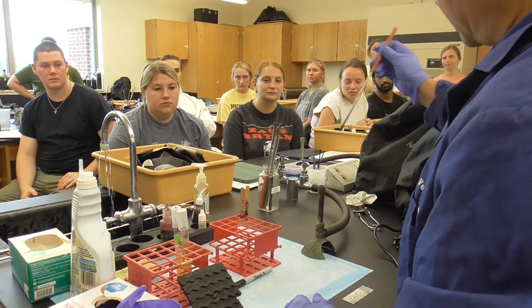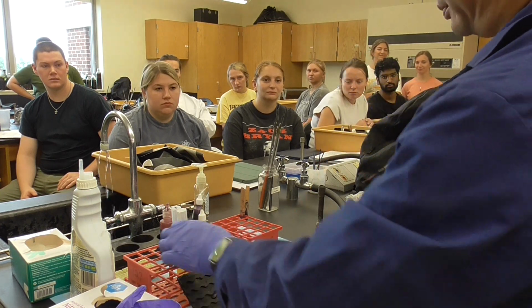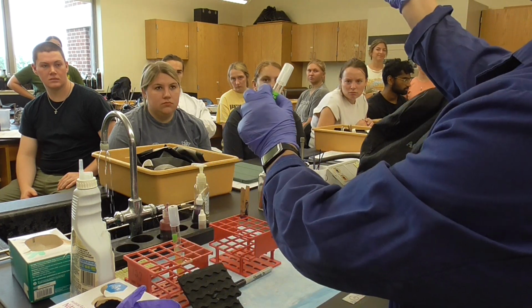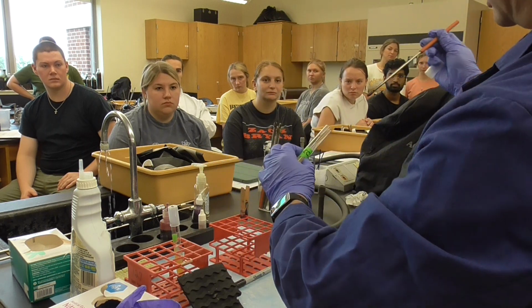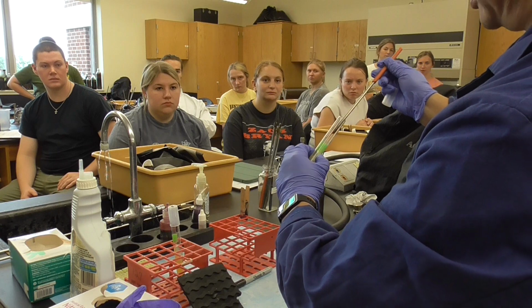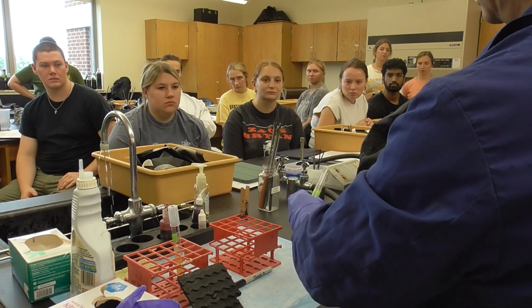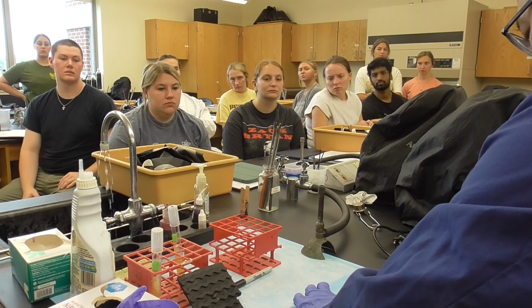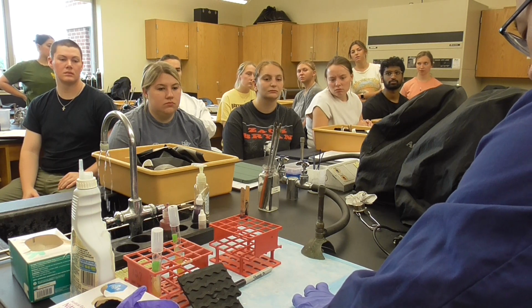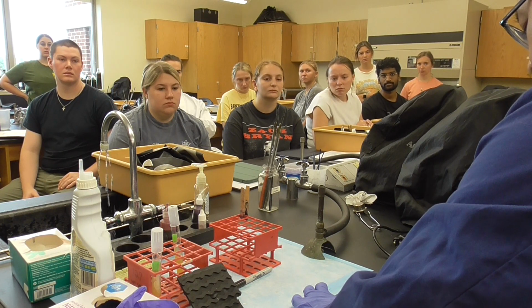So I'm going to pick the bacteria. How do we do it? Sterilize the loop again. Okay, a little bit on the top. So you have E. coli, what you do, take it out, flame, and then you cool it down on the side and you pick from the smear. Don't block it, okay. Flame at the back. That's where we put the E. coli. So you make a big smear. That has to be thin, not heavy. I have to emphasize this has to be thin, not the heavy one.